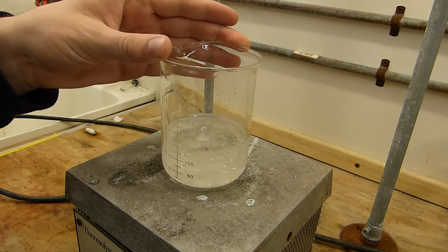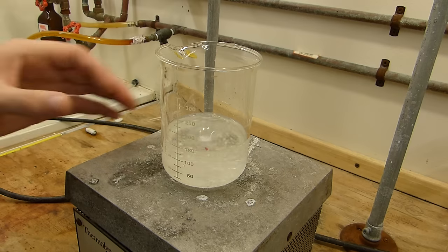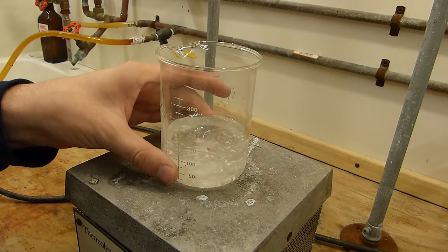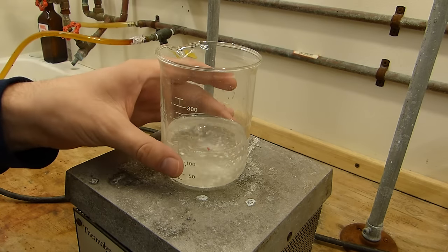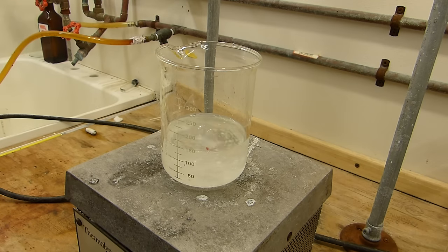Also you're going to want to put about 200 milliliters of water in the freezer and this will be used to wash the benzoic acid product after. You want to get it as cold as possible so you don't wash away any of the product. So I'm going to go ahead do that while I'm waiting.